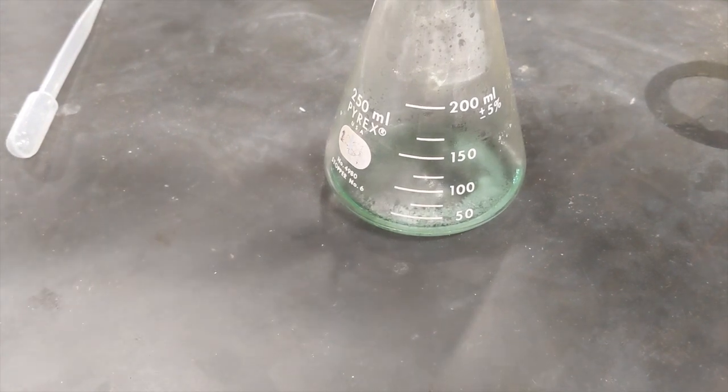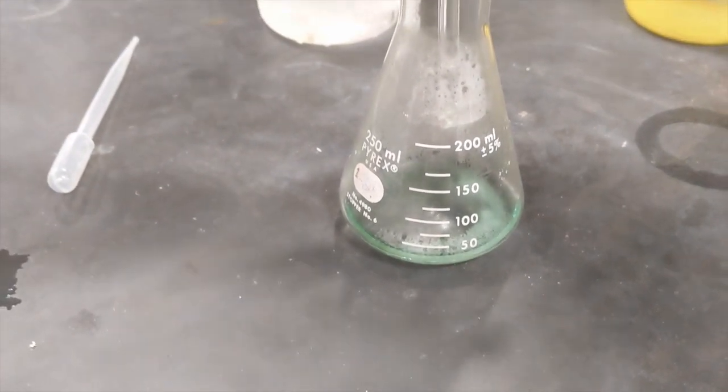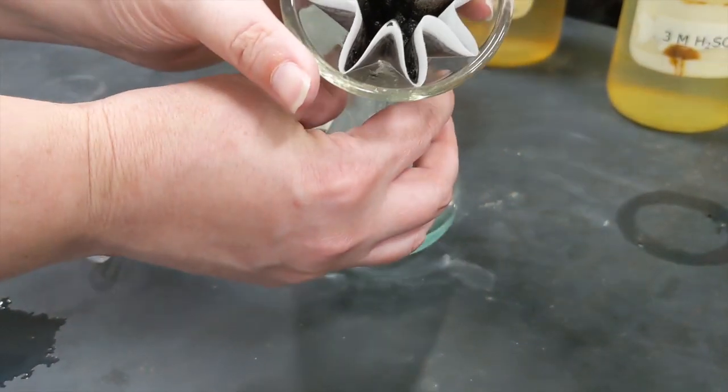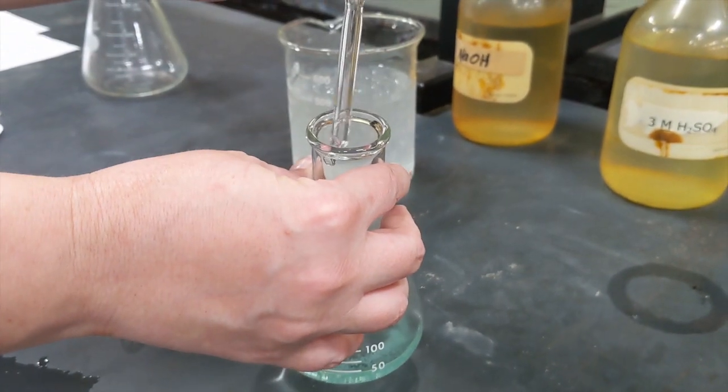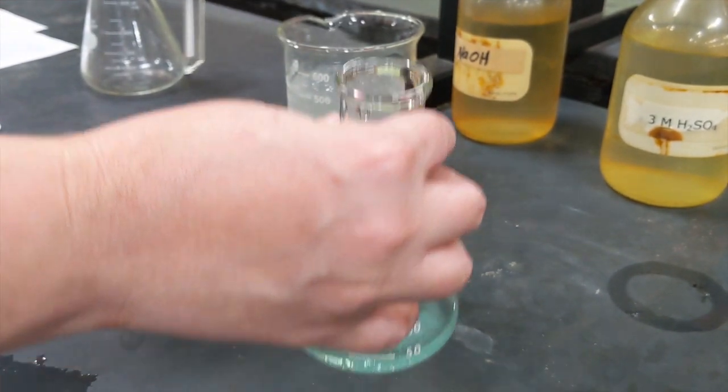All right, so our gravity filtration is looking good up here in the filter. We don't really see any liquid left, and I haven't seen a drip in a little while. So we're going to call this good enough.